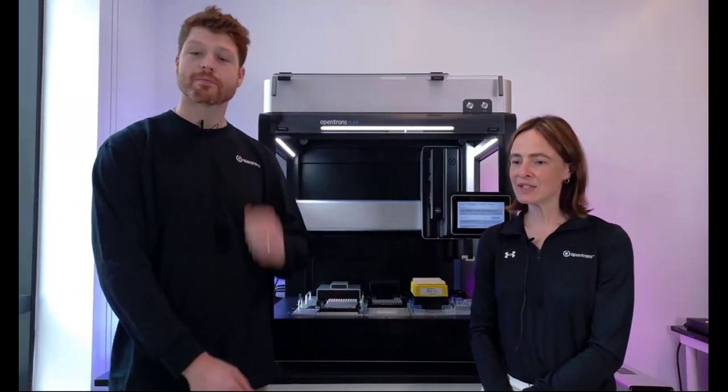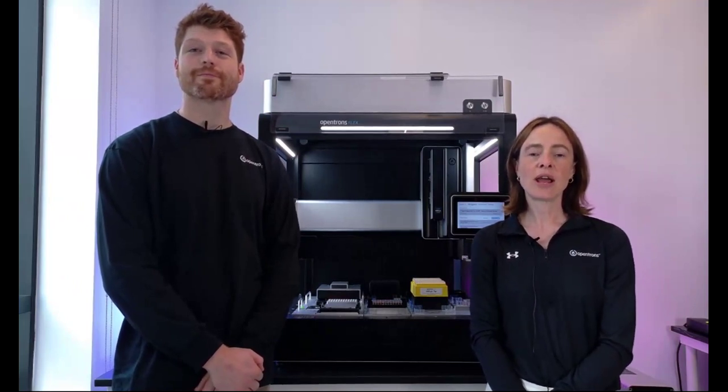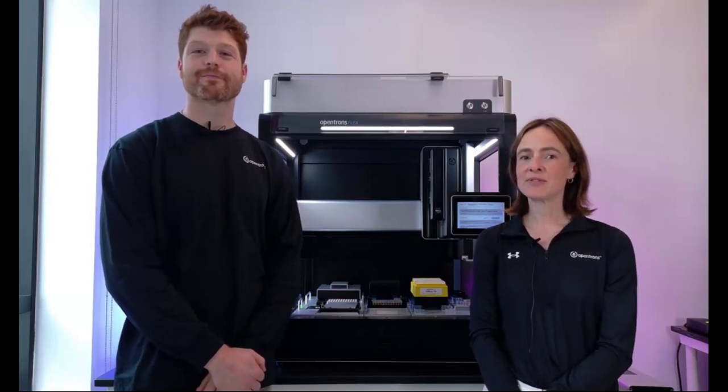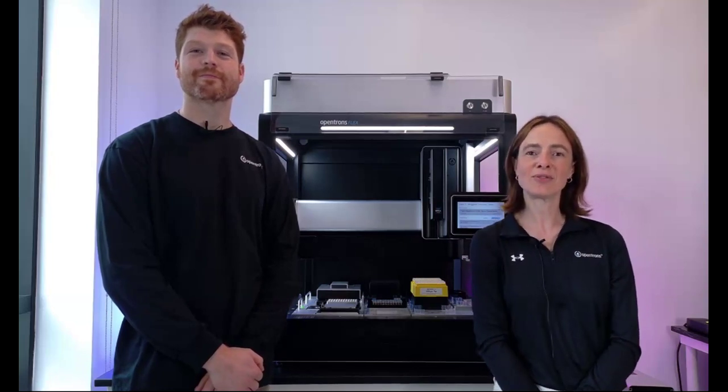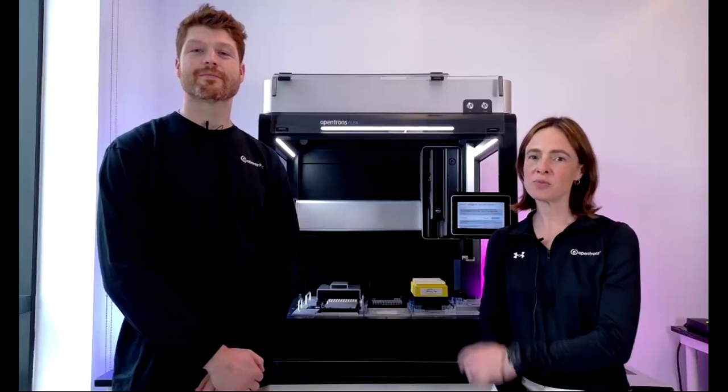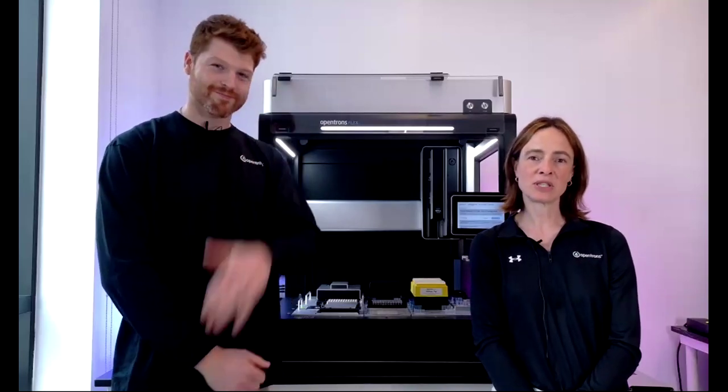Good morning and afternoon to everyone, and welcome to the live demo webinar focusing on how to automate your workflows on the Opentrons Flex. My name is Fran Slater. This was supposed to be a Nick and Nick show, but unfortunately Nick couldn't make it, so you have me instead. But I am joined with one of my colleagues, Nick Ritzo, our product specialist.